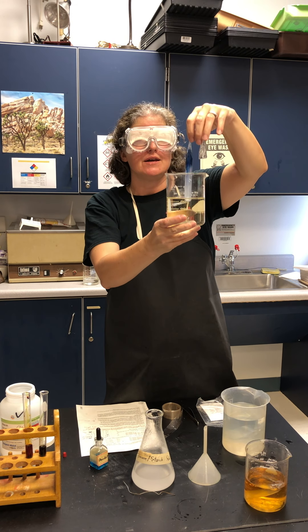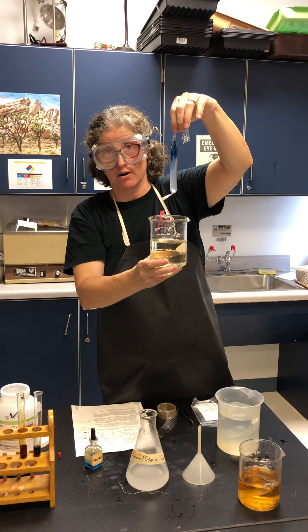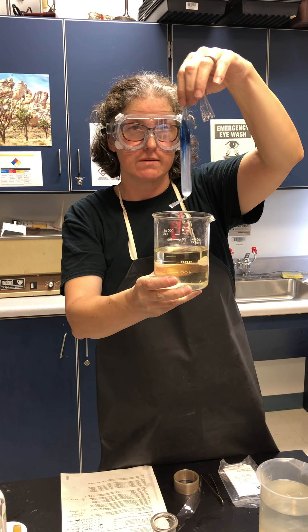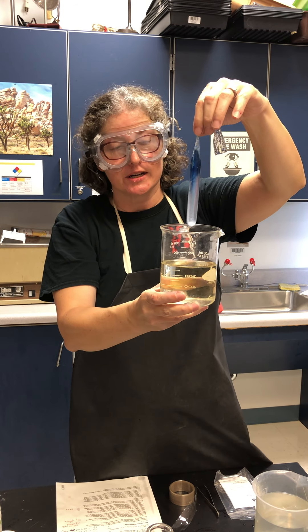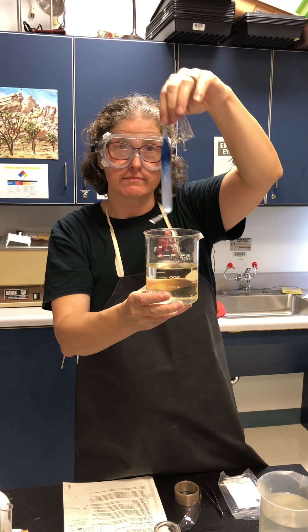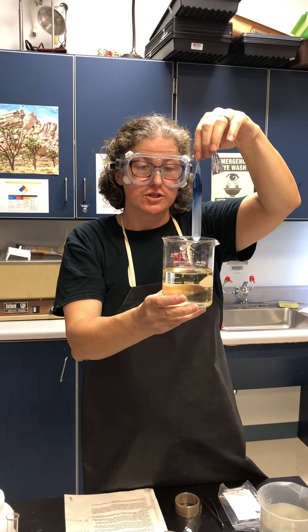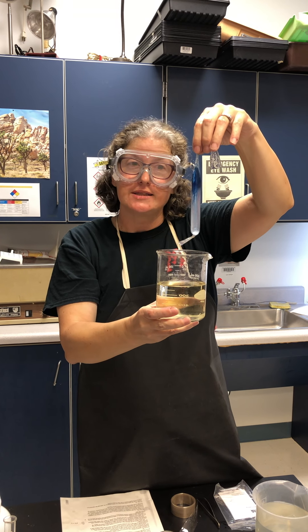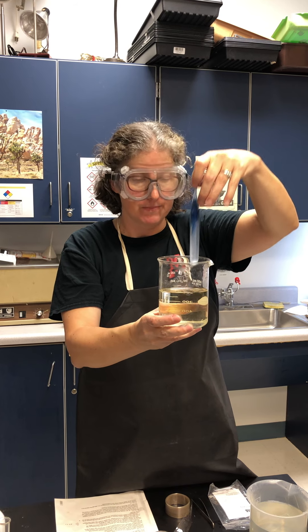Did the starch move into the beaker water? Answer that for yourself. The second question is, is there evidence inside the bag of a reaction between iodine and starch? Did the iodine move into the bag and find the starch? So: did the starch move out? Did the iodine move in? Those are your two questions — I'm not going to tell you the answers.